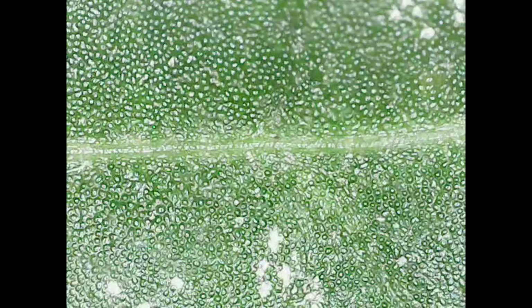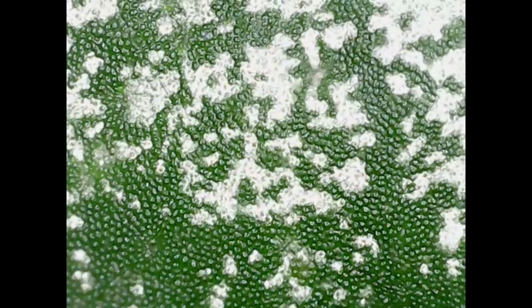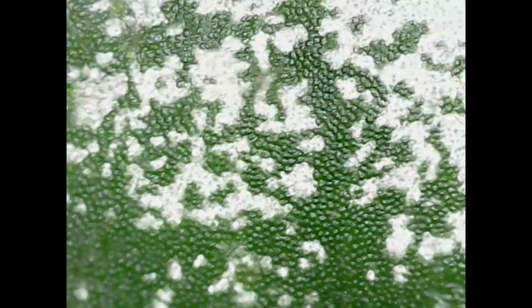And again, here you can see a different version of that leaf, but here you might be able to see kind of more that dotting that's happening. And you can see that maybe it isn't truly white. There might be some silveriness and the microscope is picking it up there. But you can see here, maybe a bit clearer, those blisters of air. And that's what's giving it that silvery appearance.